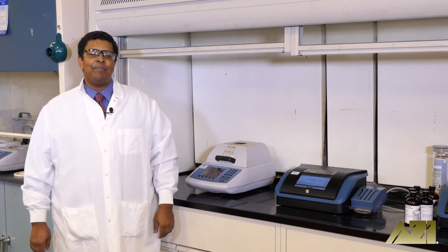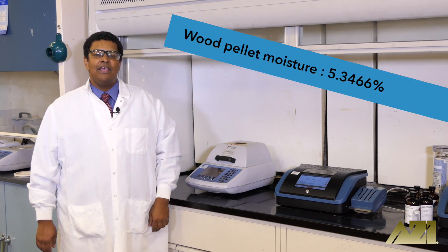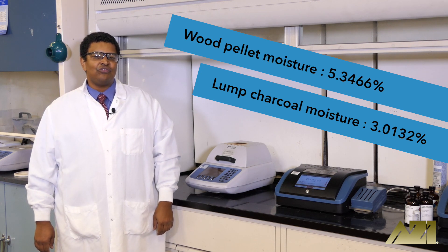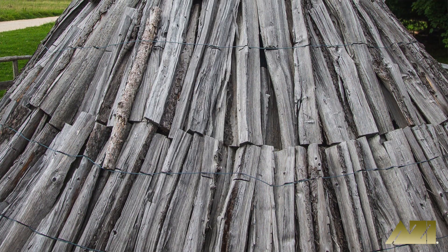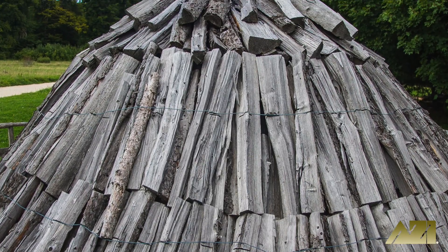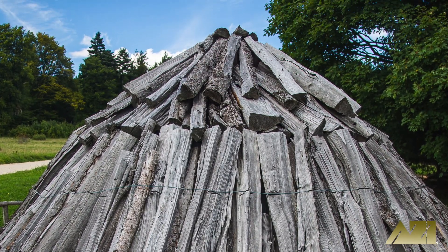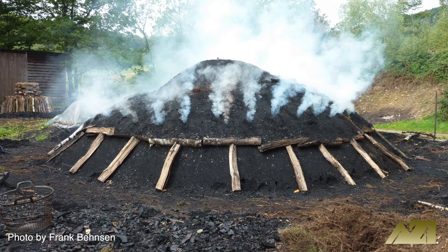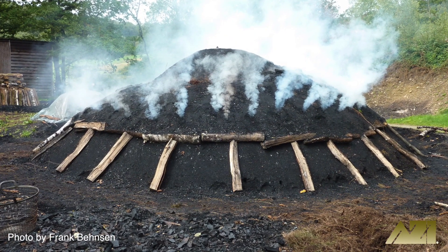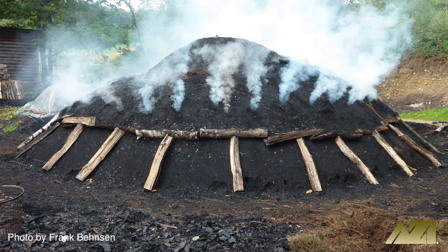With our test completed, you can see that the wood pellets have approximately 75% more moisture than the lump charcoal. This could be due to different drying specifications. It could also be because the charcoal we used is made from wood logs that have undergone pyrolysis, which is a process that drives out water and other organic materials so that the resulting product has greater BTUs per pound than the wood from which it originated.